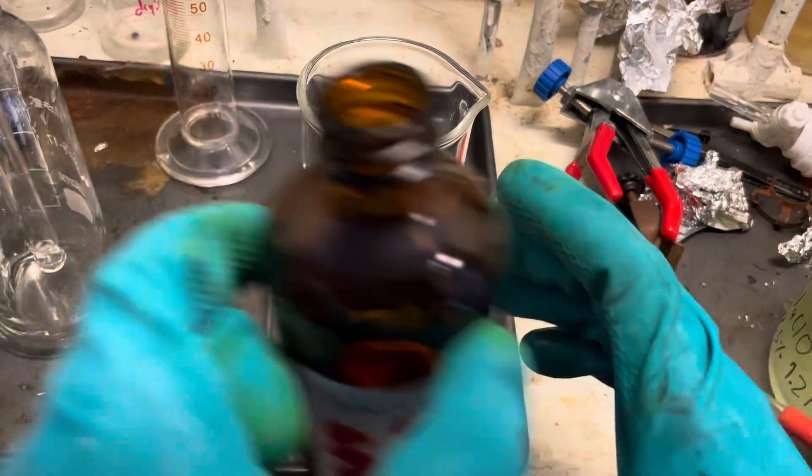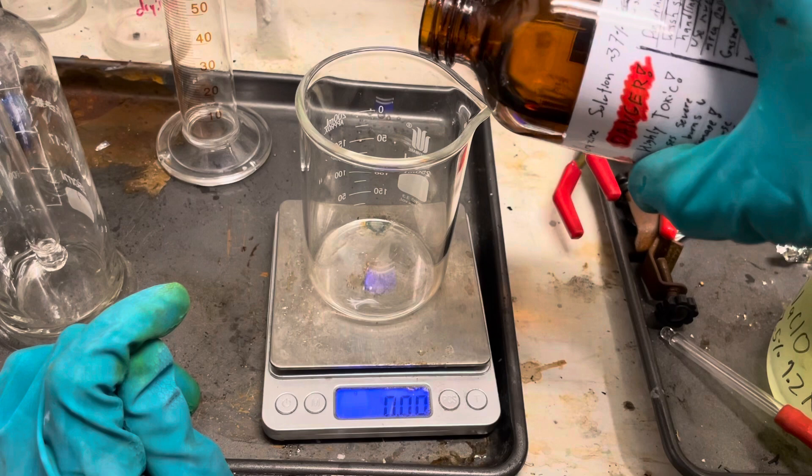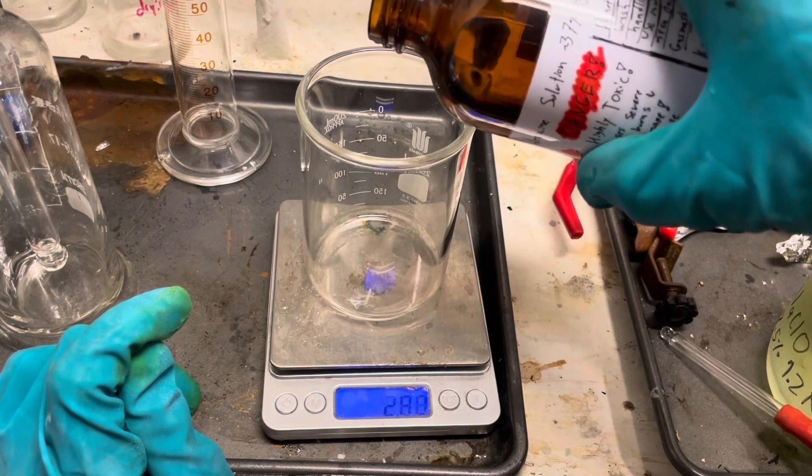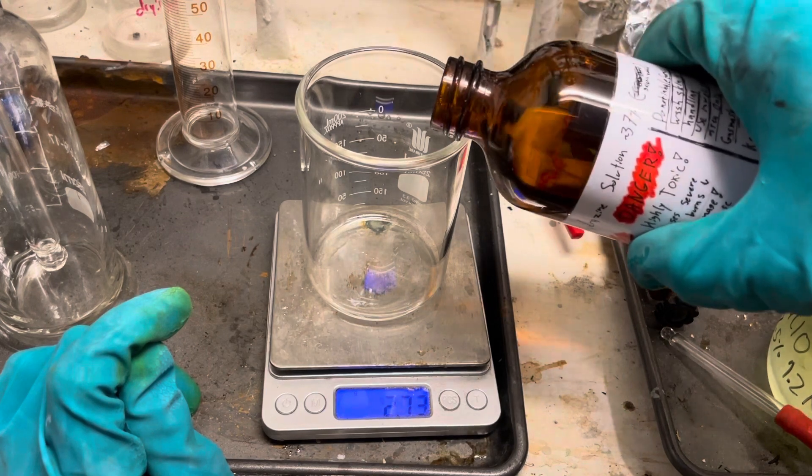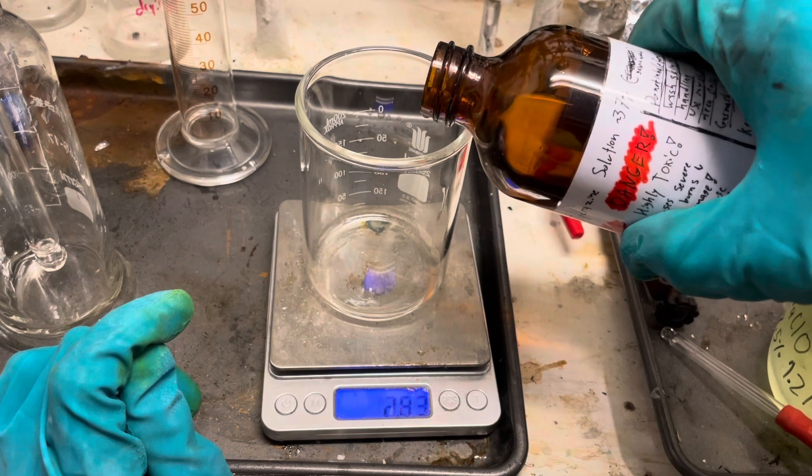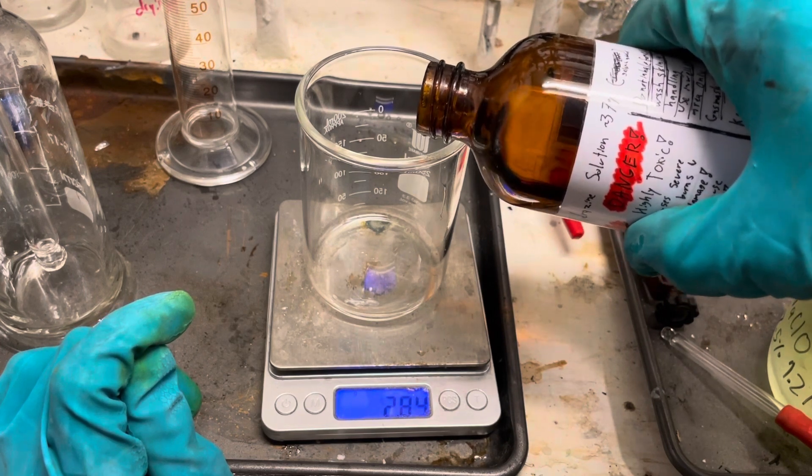We're going to need a tiny amount of hydrazine, not too much. I'm going to measure it out gravimetrically because I don't have small graduated cylinders. Also, this video footage is old if you couldn't tell. I measured out 3.5 grams of our hydrazine solution here.